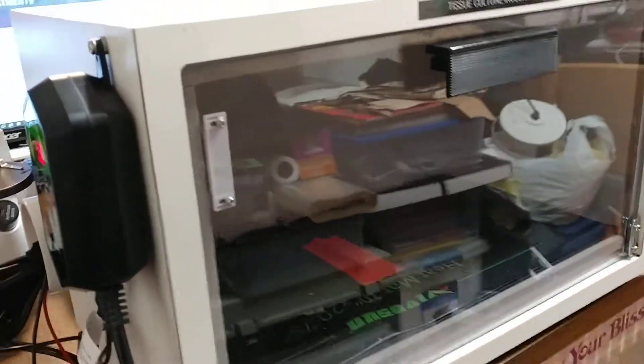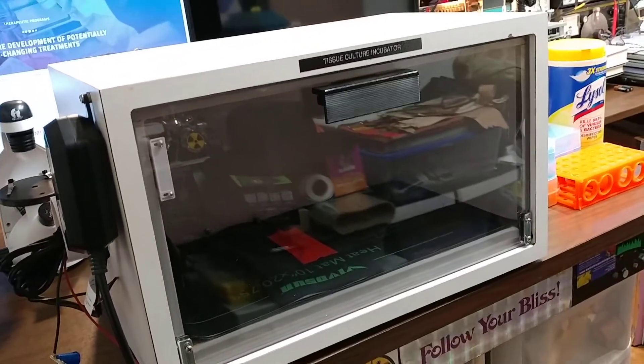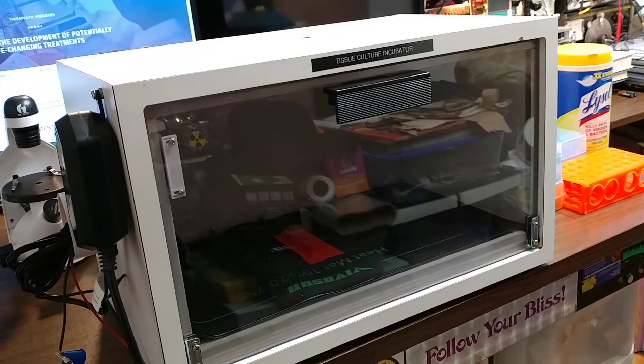This should work well. There it is. Looking forward to my new cells — I hope that I don't massacre them all this time.